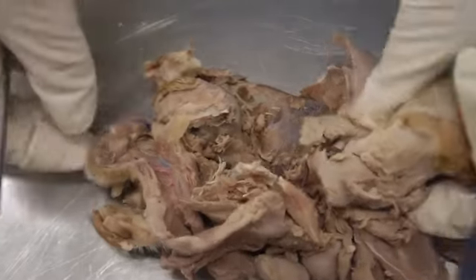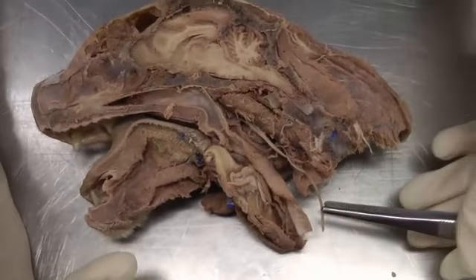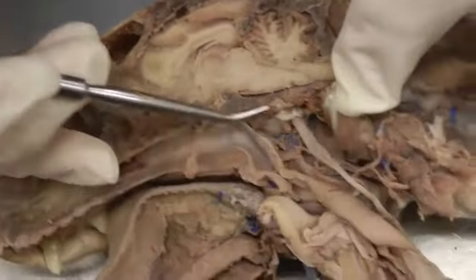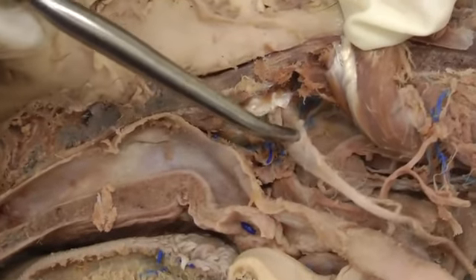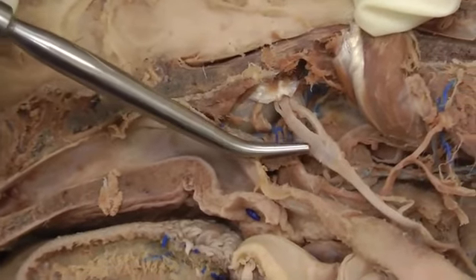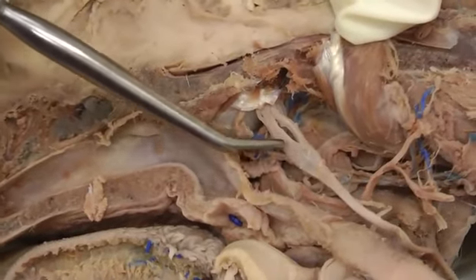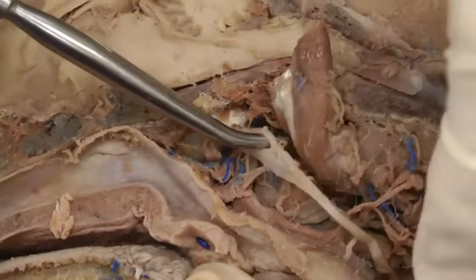Then we have the medial side to do. So here we're following the vagosympathetic trunk, and you're cutting that longus capitis muscle and reflecting it caudally. In the cat, it's a little bit harder sometimes to differentiate the two pieces, so just do your best. The most cranial, most rostral aspect is going to be the cervical sympathetic trunk here, and then this little enlargement would be the cranial cervical ganglion. And then here you would have the vagus joining that.